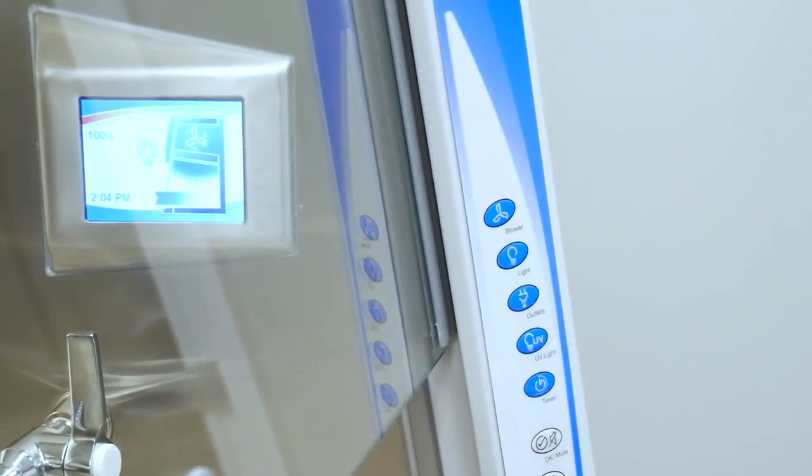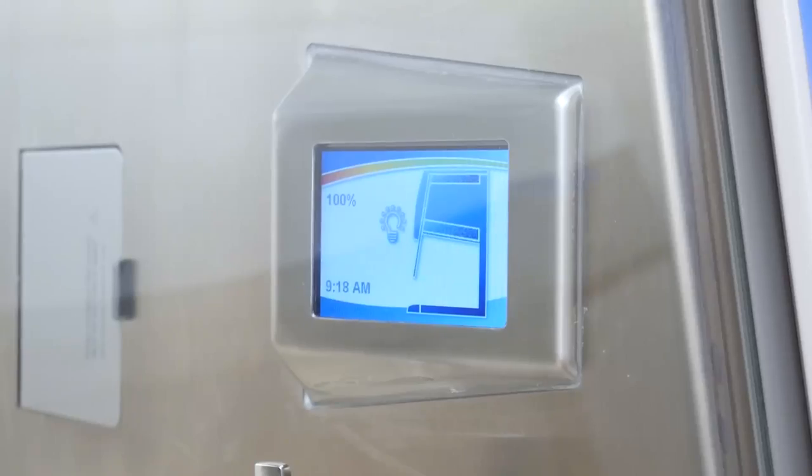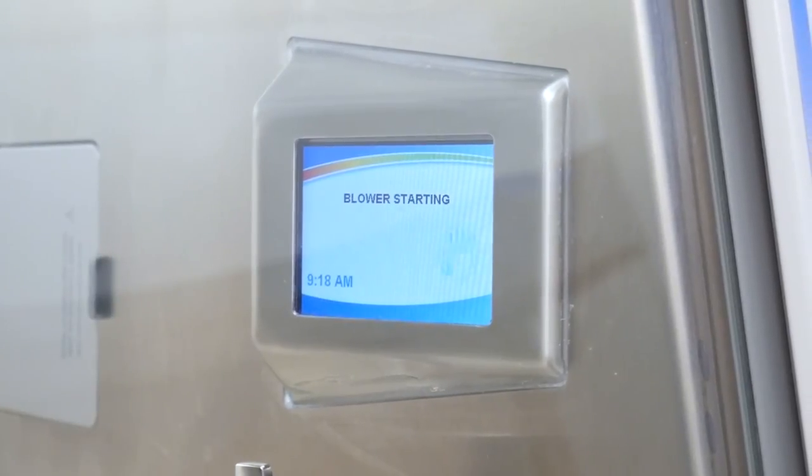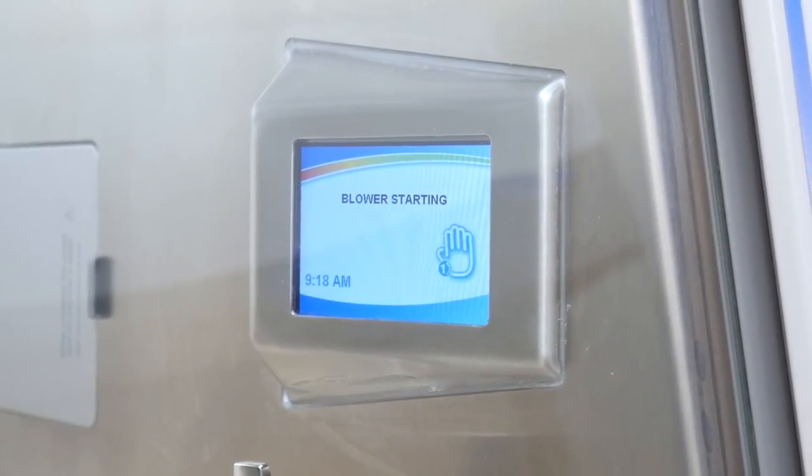The MyLogic operating system is an intelligent platform that controls the cabinet and informs users of all operating conditions such as airflow speed, alerts, and alarms.